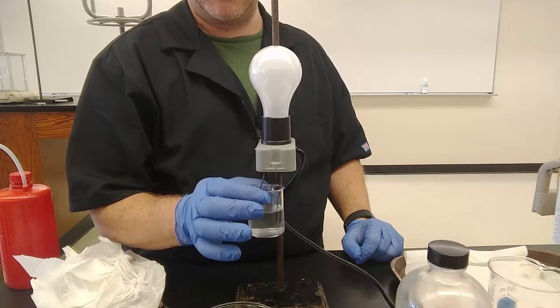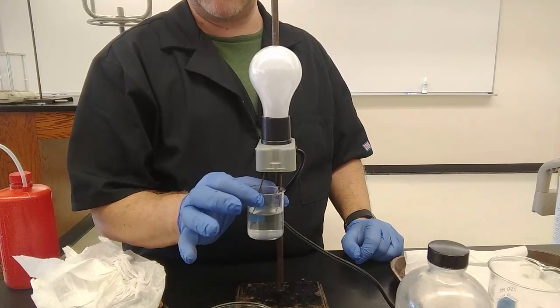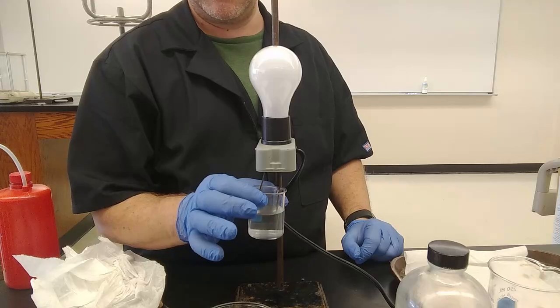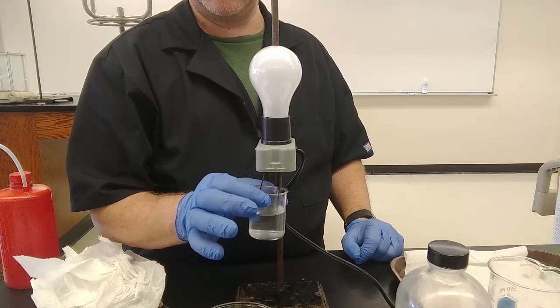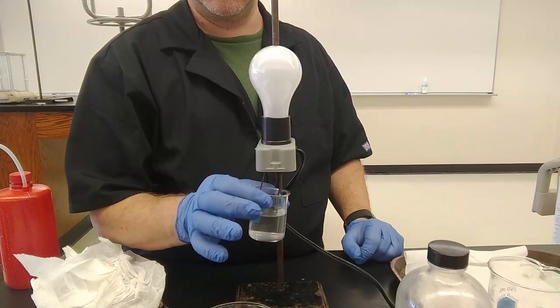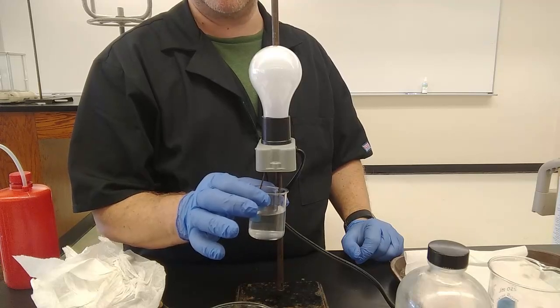There are no ions in melted sugar. There are ions in melted magnesium hydroxide. This is not melted magnesium hydroxide. This is magnesium hydroxide that is not even dissolved in water. Dissolving and melting are not the same thing. When we did boiling points and melting points, experiment 2, we melted a solid. We didn't dissolve it in anything. Dissolving it in something is making it into a solution, making it into a mixture.